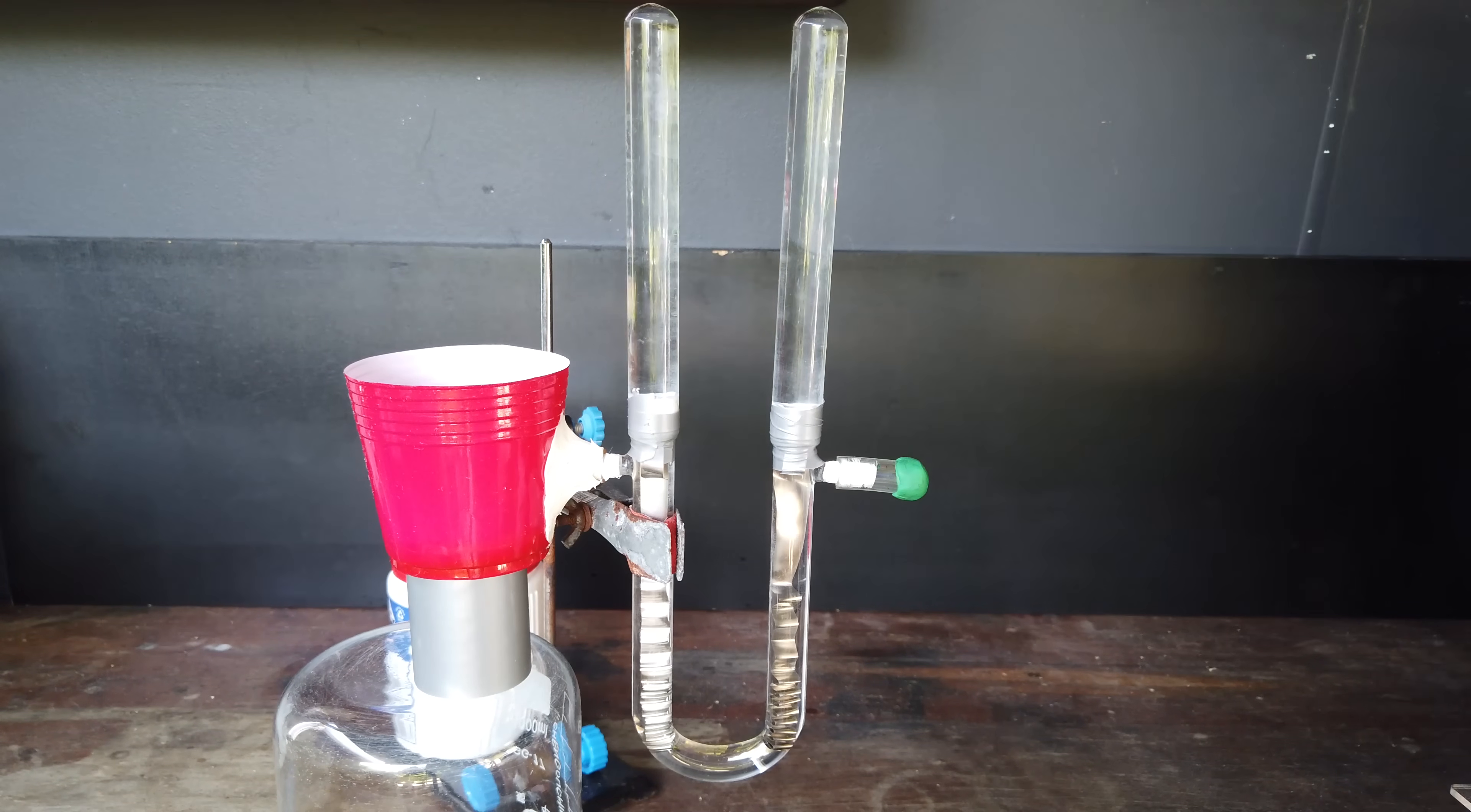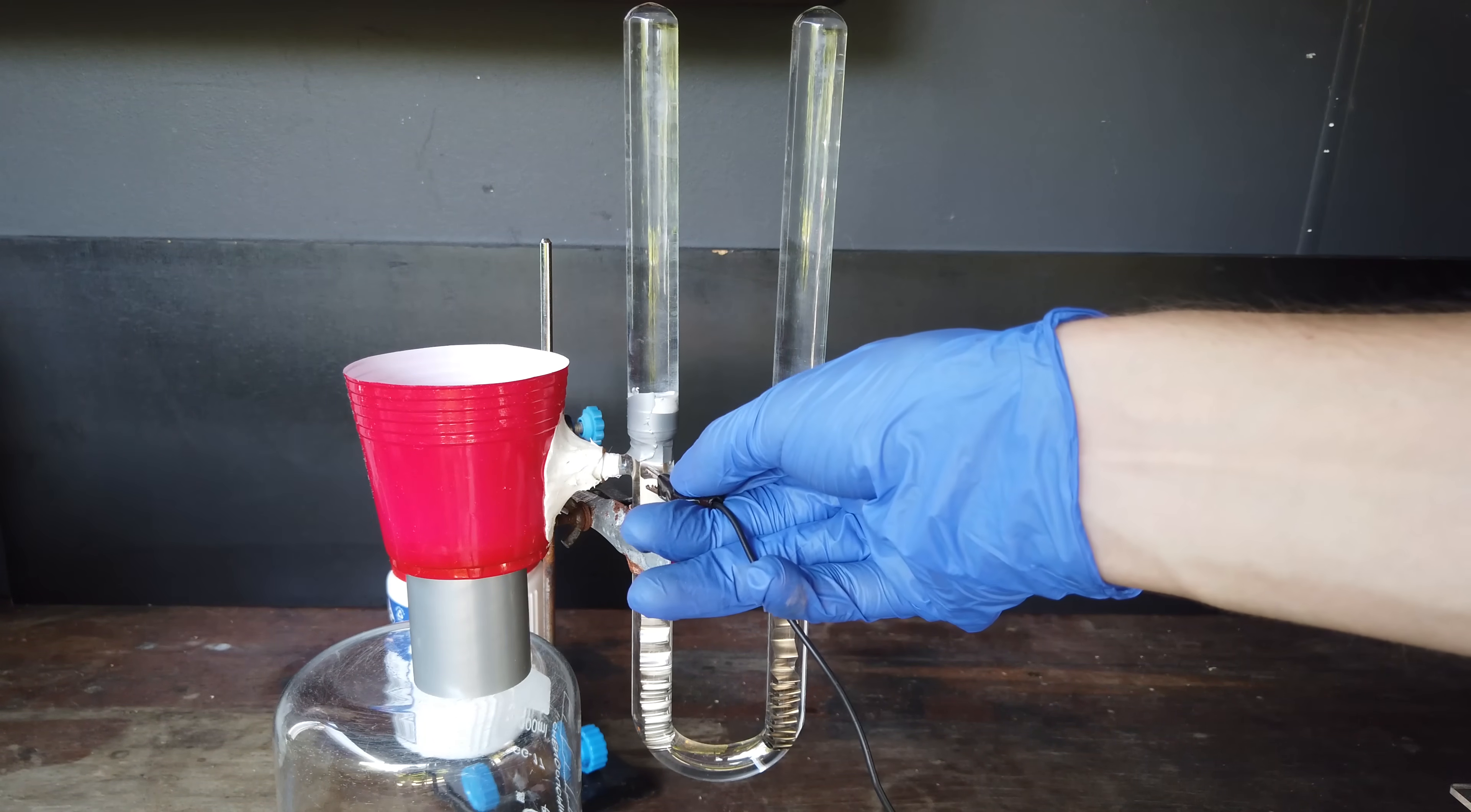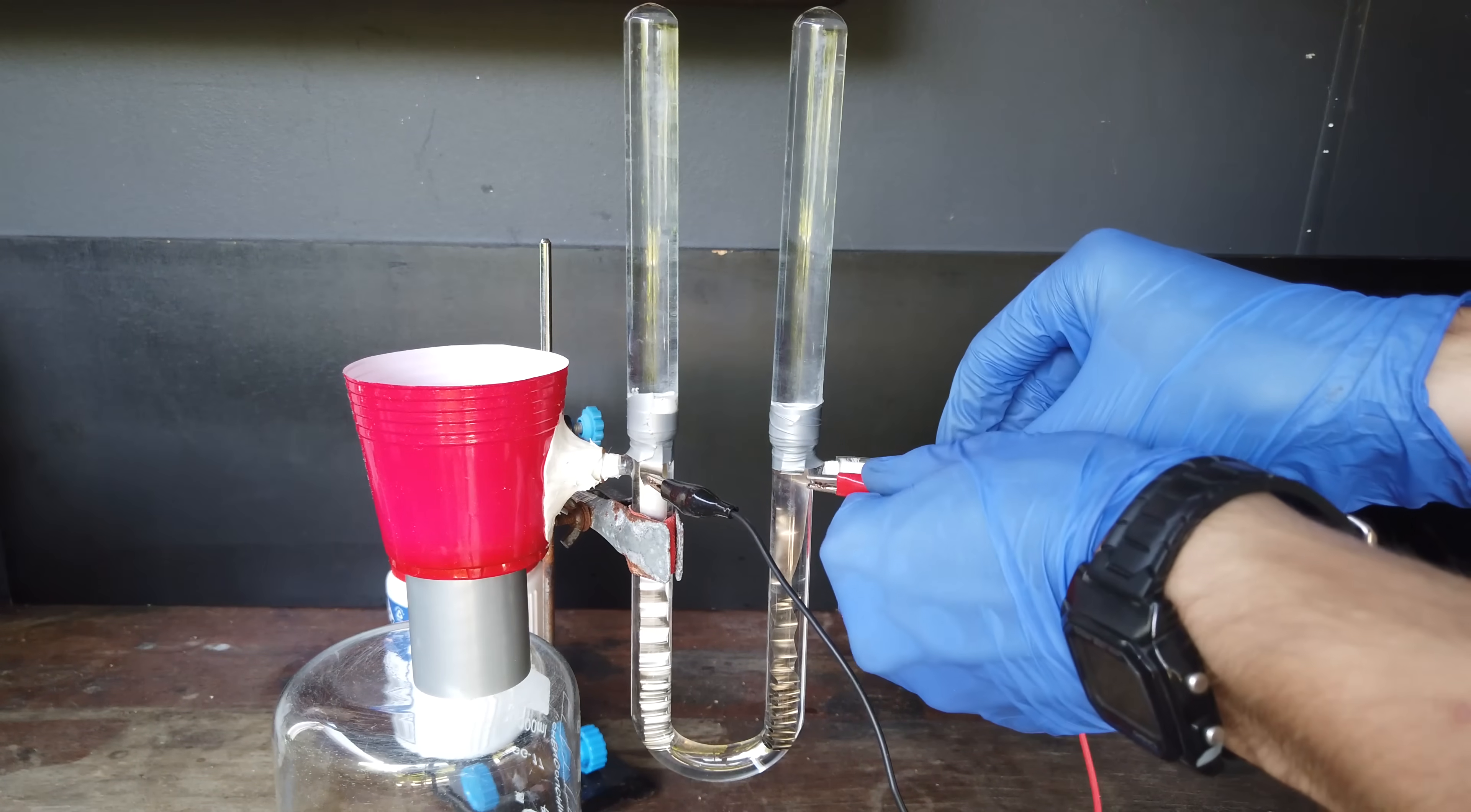Anyway, let's get right back into it. And we'll connect up 1.5 volts to the cell again. Negative on the left and positive on the right.